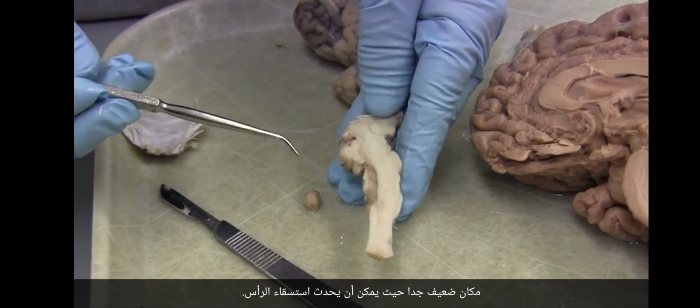This hole is called the foramen Monro. It's spelled without an E, so M-O-N-R-O, Monro without an E. And there's a Y. So from the third ventricle, there's a Y that goes out to the lateral ventricle on either side. And that's what this is. I've just sort of torn back the septum, and this is the lateral ventricle. This thing that's overlying it, this is the corpus callosum, if you remember that.